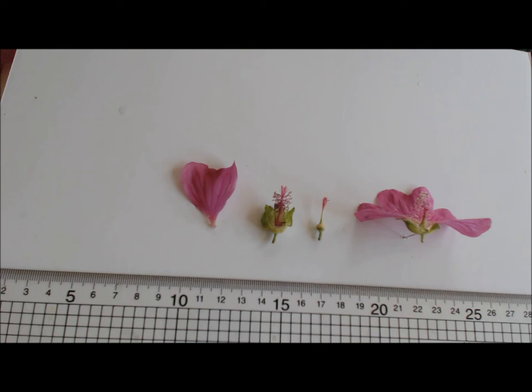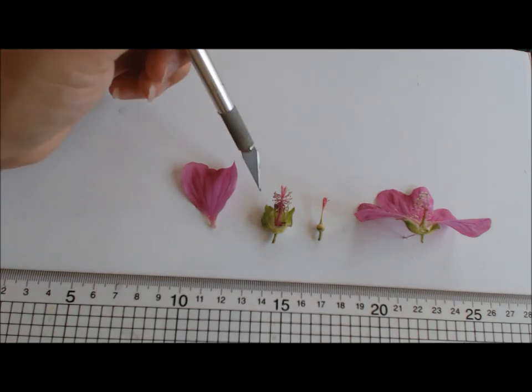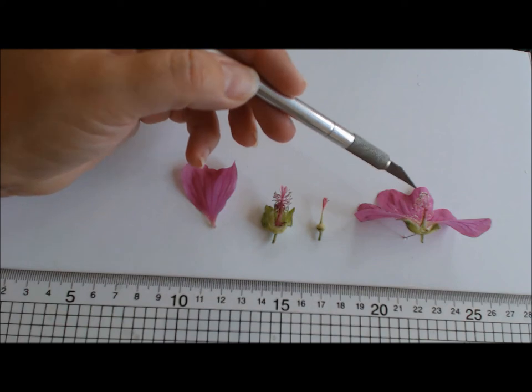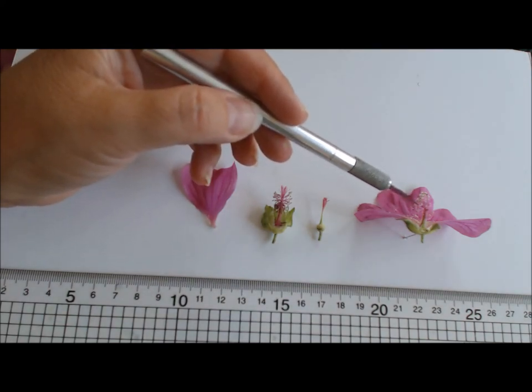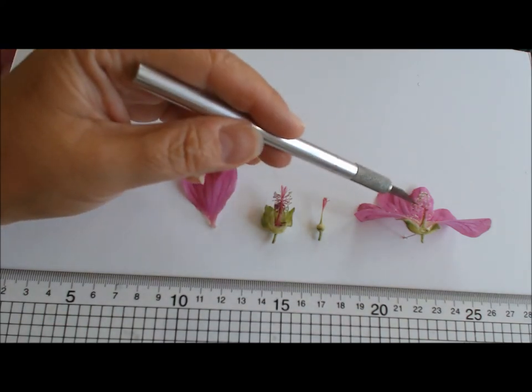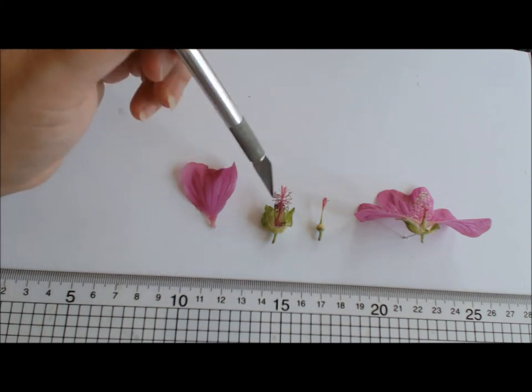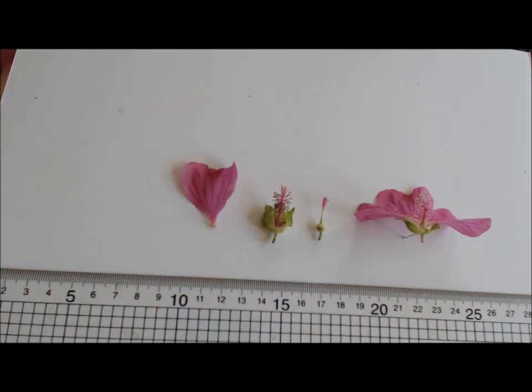That's about it really for the basic dissection. As I say, you can include more parts, take off the individual anthers and filaments and measure them too, so they could go along the side. But you start to get into smaller and smaller parts. The smaller the parts are, the more difficult and the more chance you'll need magnification to do it. But I would suggest for your first attempt to try slightly larger flowers.